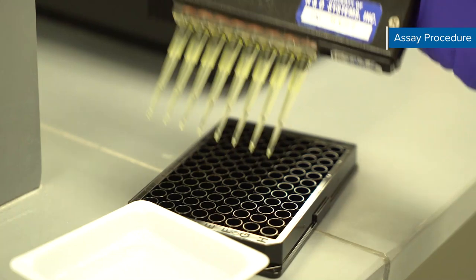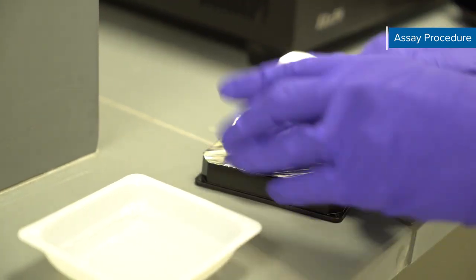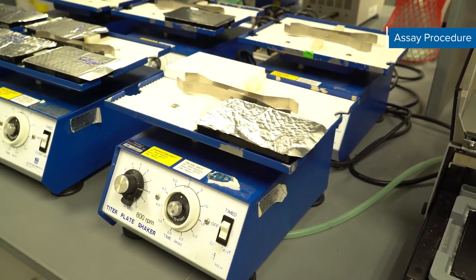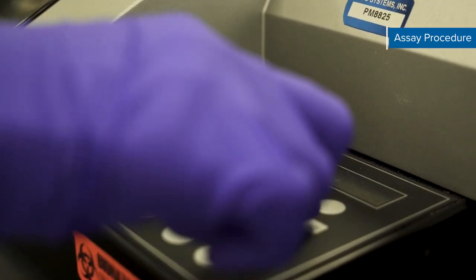Next add 50 microliters of diluted streptavidin PE to each well. Securely cover with a foil plate sealer and incubate for 30 minutes at room temperature on the shaker. After the 30 minute incubation repeat the wash step for a total of three washes.